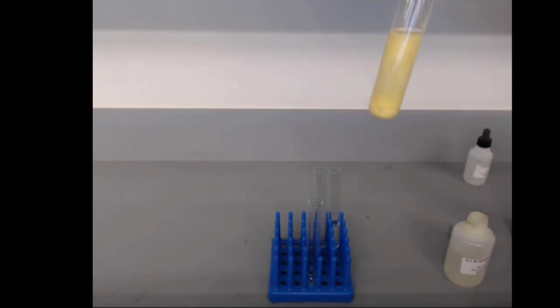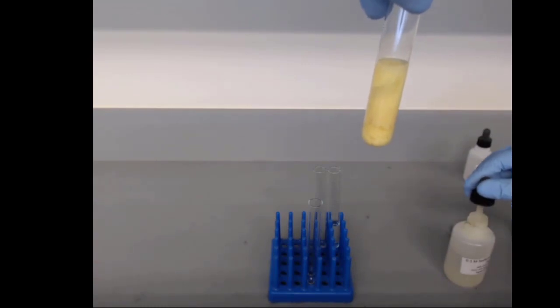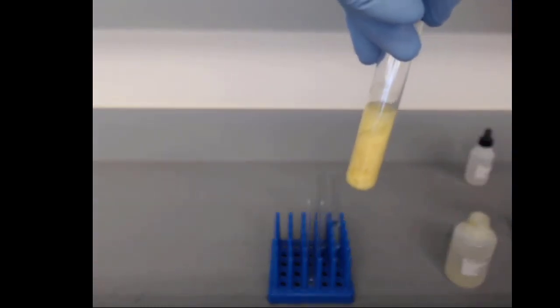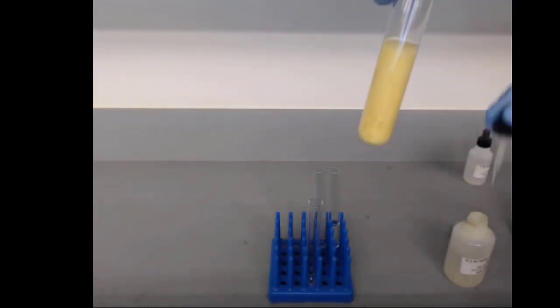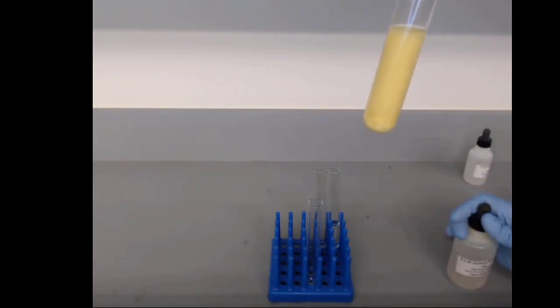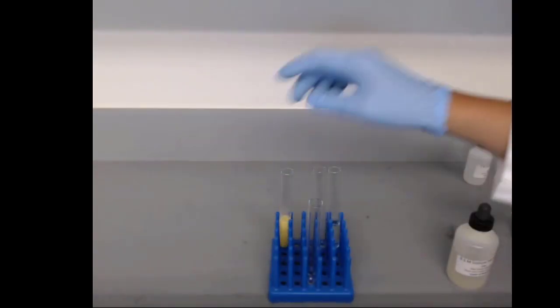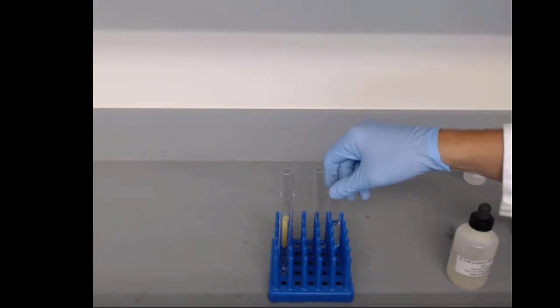Oh yeah, see, there's more solid forming. Now at some point we won't form any more solid, and that's because we need to think about not just will a reaction happen or not, but how much does the reaction happen? That gets into the idea of stoichiometry, extent of reaction, and we'll talk about that next time, or next week.